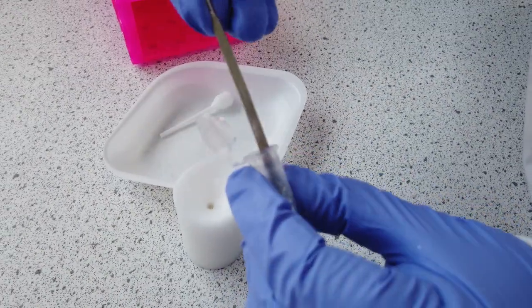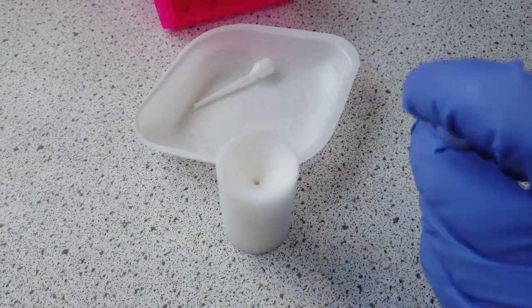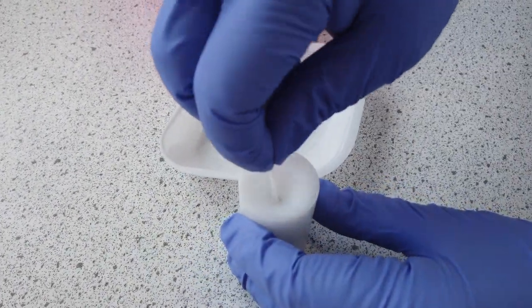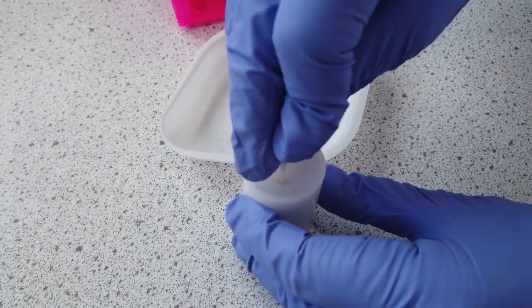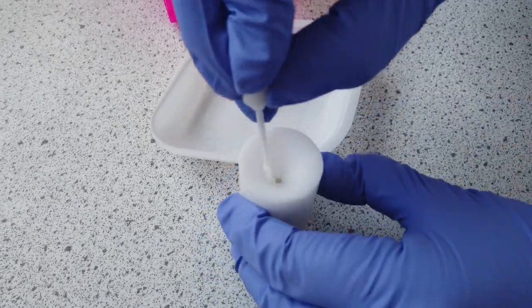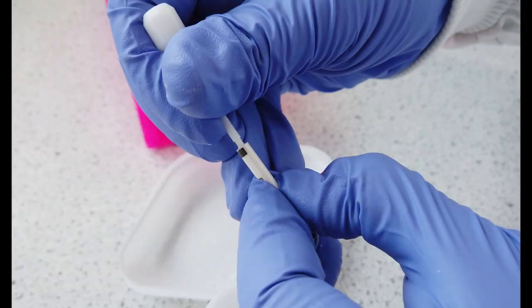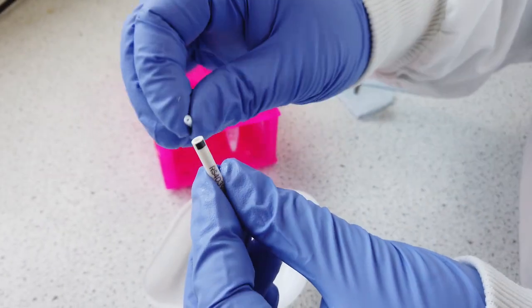Repeat this until the rotor is fully loaded. The groove on the sample packer indicates how much you can fill the rotor to leave space for the top spacer. If you add too much sample, you will need to remove some so that you don't see past the recess of the packer.